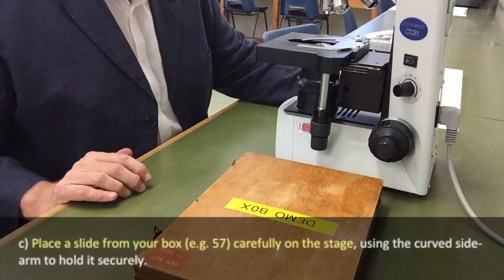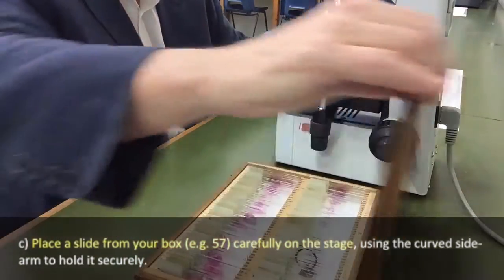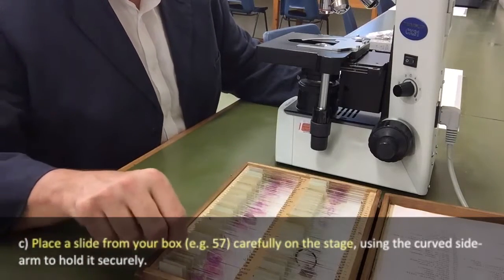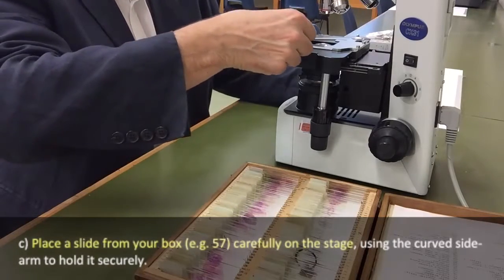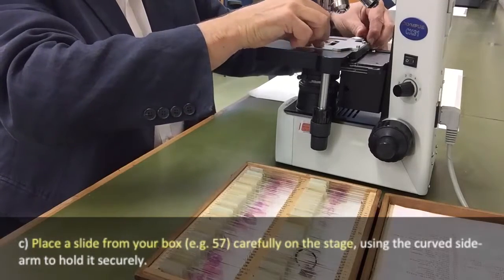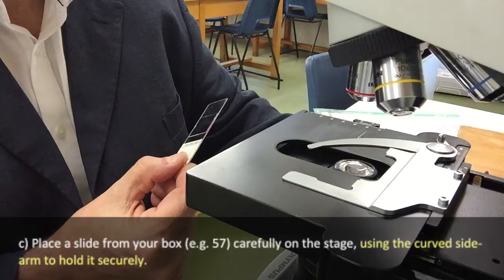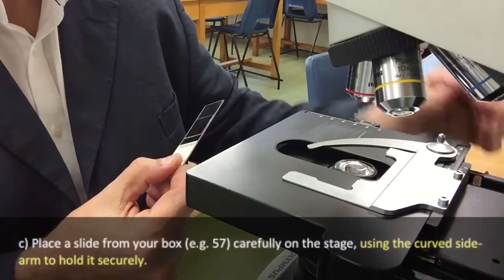Open your slide box and select a slide to be used in focusing the microscope. Place it on the stage and use the curved sidearm to hold it securely in place on the stage.